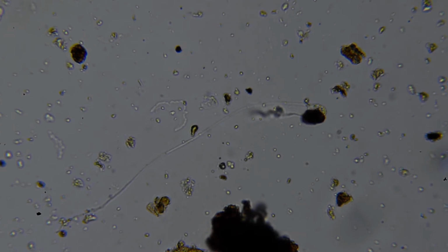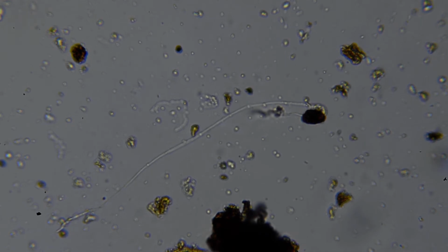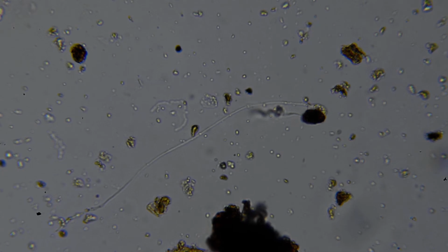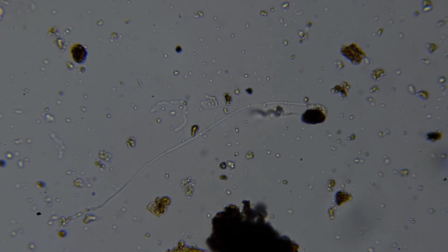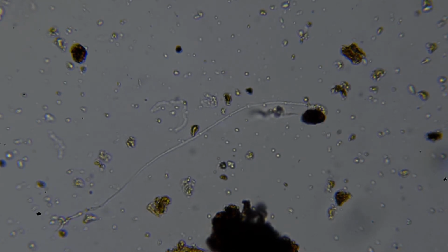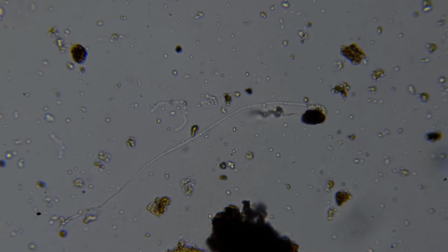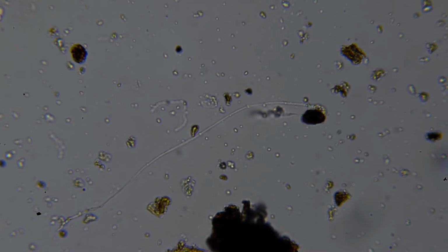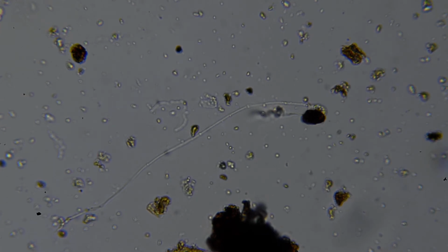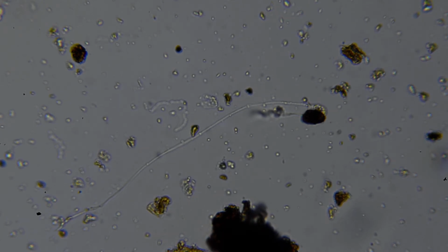Let me just have a look at it on the microscope. It looks to be a fungi of some description because there are cross walls that you can just about make out, the division of the fungal cells. So after the fungi has grown a cell's width, it lays down a cross wall. But it looks to be not very beneficial. Firstly, it's glassy white, which is a bad sign. It means it's not producing those organic acids that we're looking for. And it's very, very narrow in diameter.